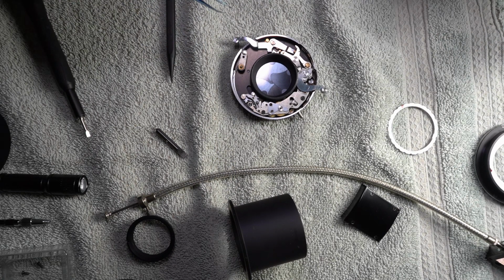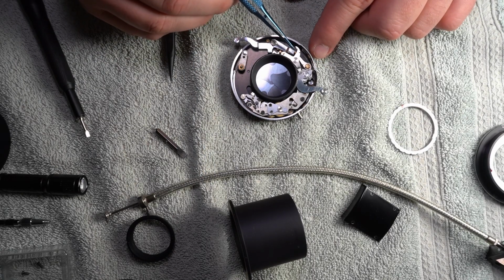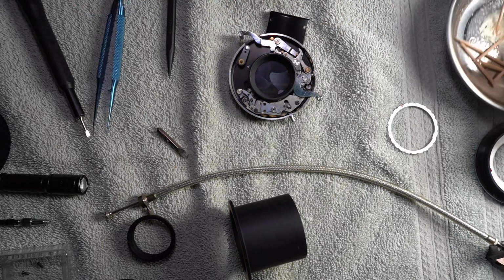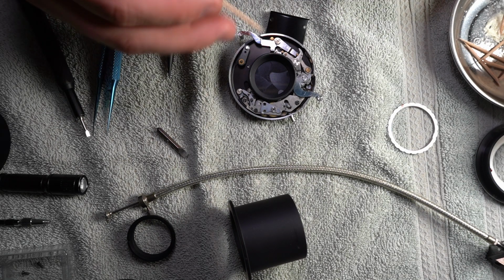But while I'm in here, I'm doing other things, and the next one I'm going to do is this pin and this piece here. Basically, I'm carving the toothpicks, and then I'm having to pick up every piece so it doesn't get into this thing somehow.